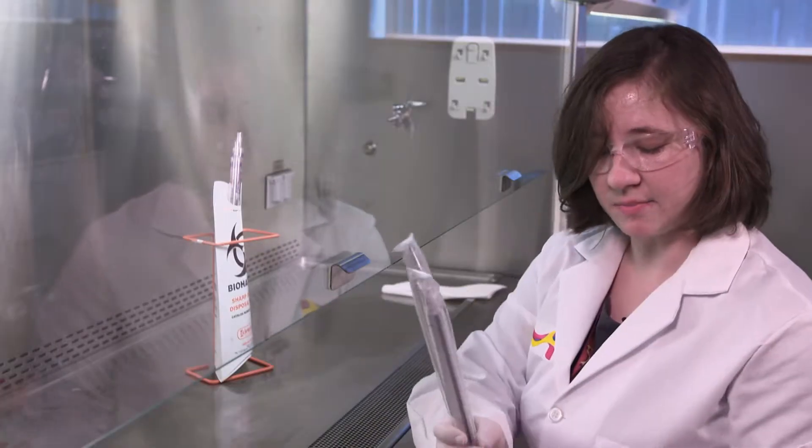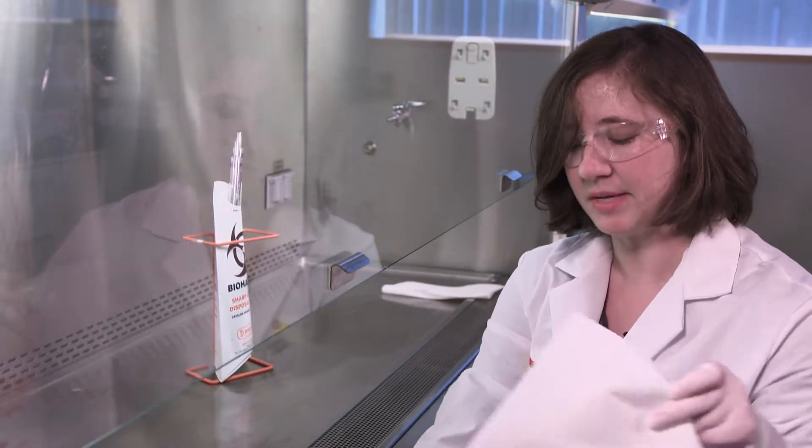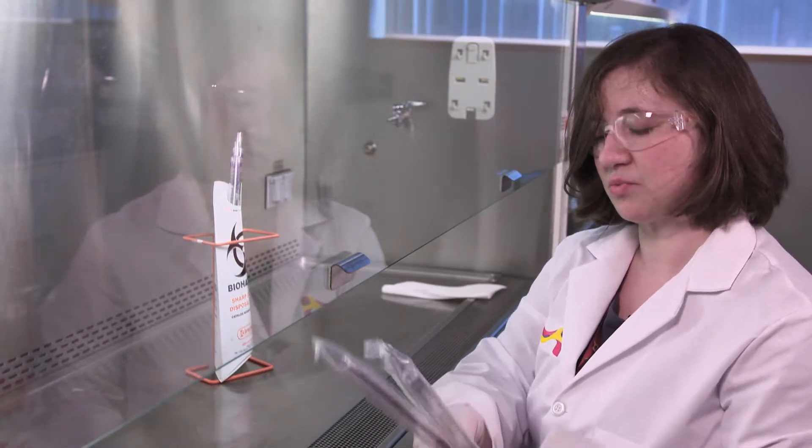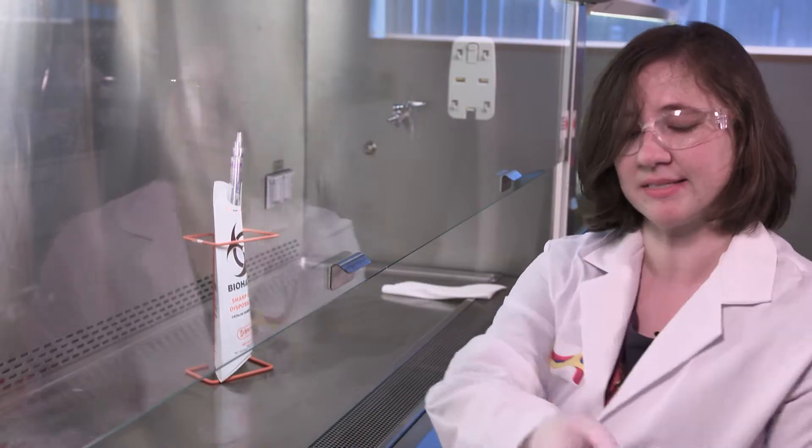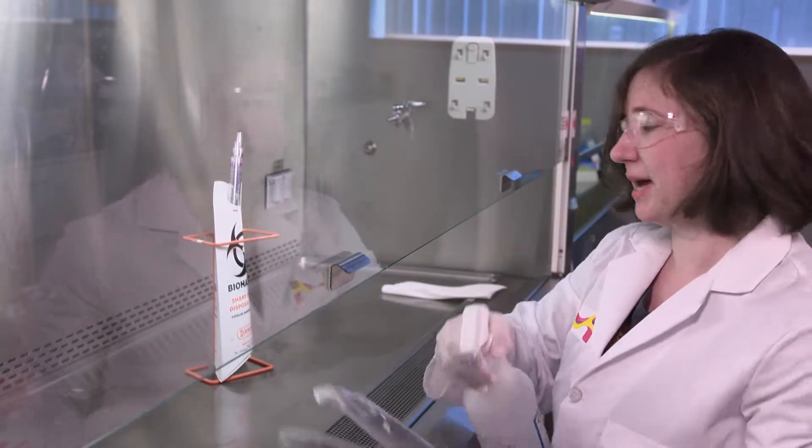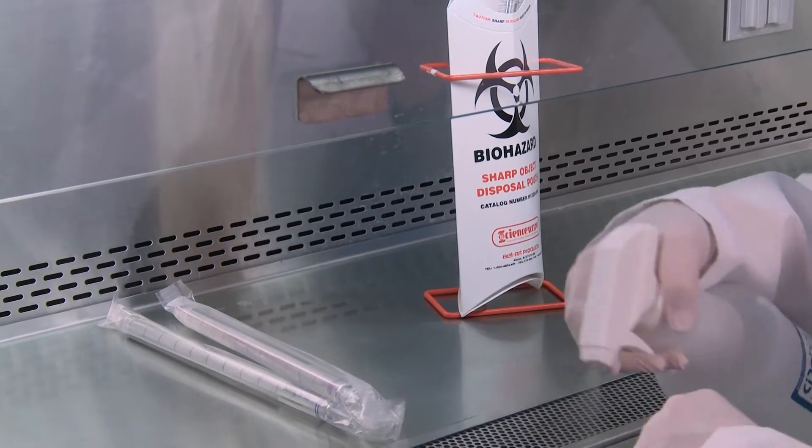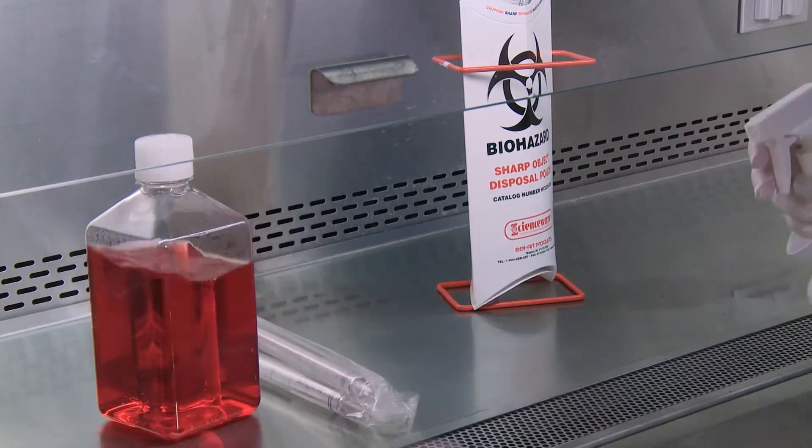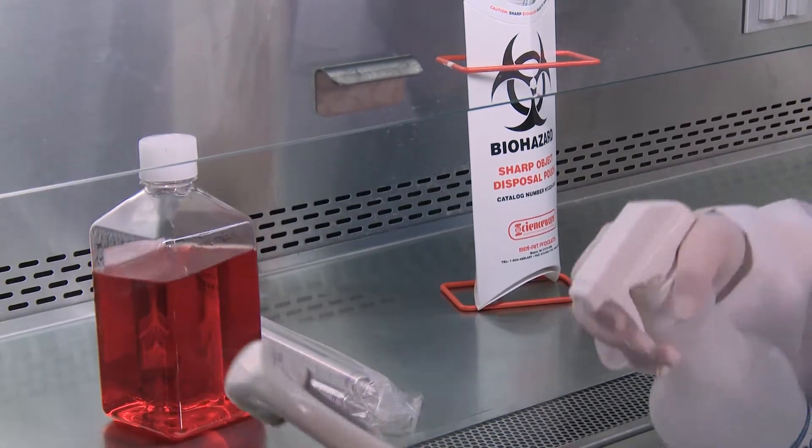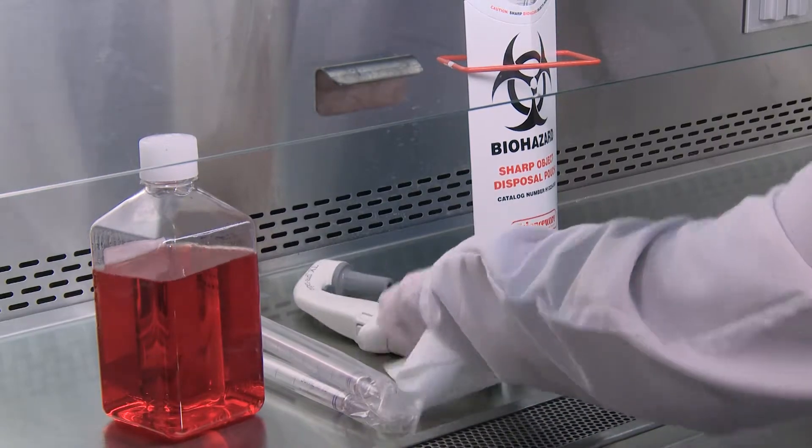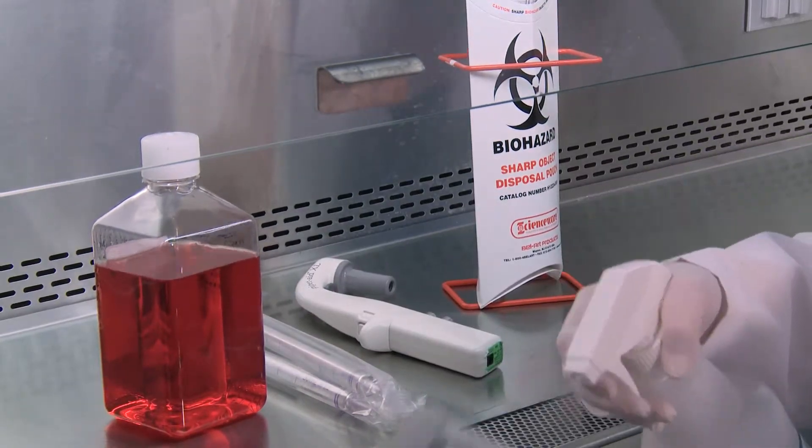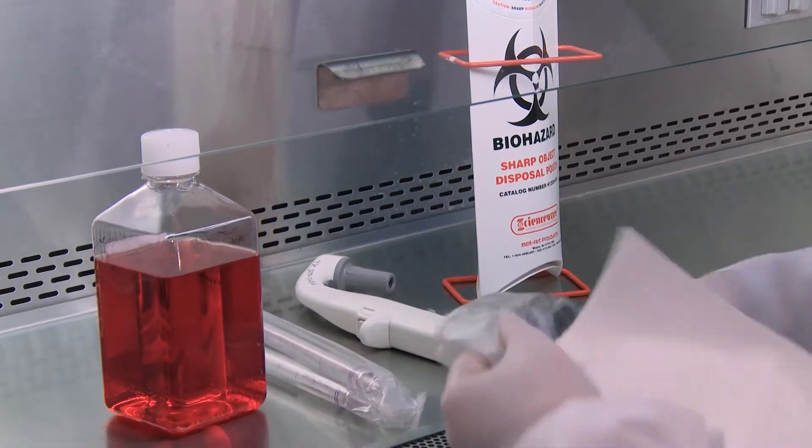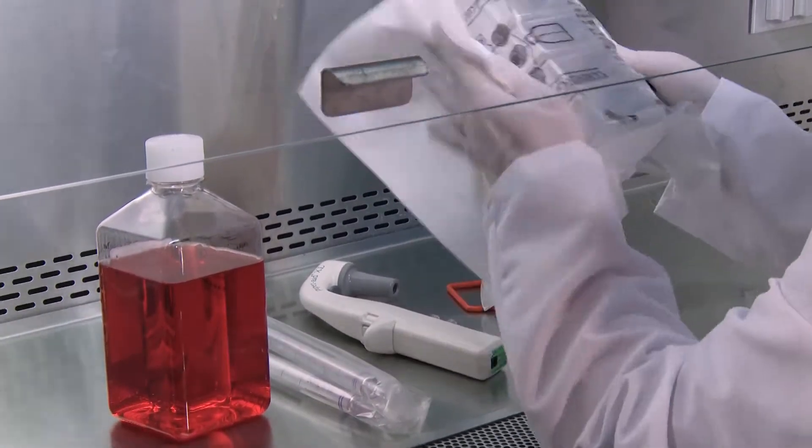Then every item that enters the biosafety cabinet, with priority to wrapped items and items that exited the fridge, will be sprayed down and wiped to remove the condensation.